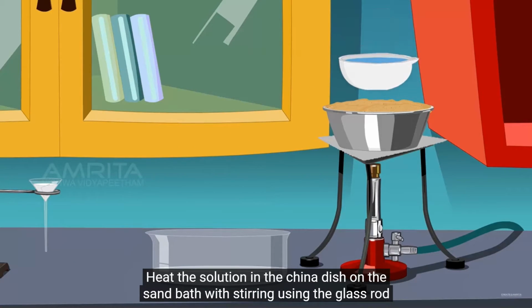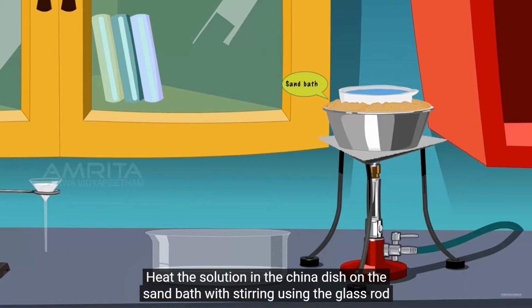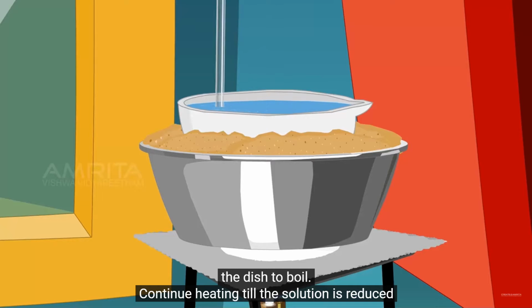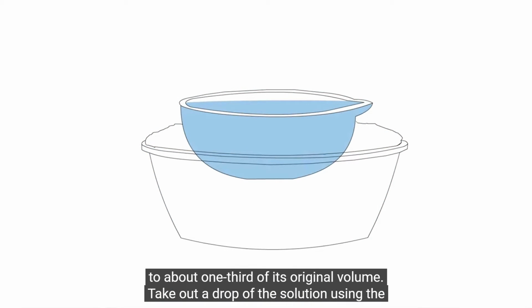Heat the solution in the china dish on the sand bath, stirring using the glass rod to avoid crust formation on the sides of the dish. Don't allow the solution in the dish to boil. Continue heating till the solution is reduced to about 1/3 of the original volume.